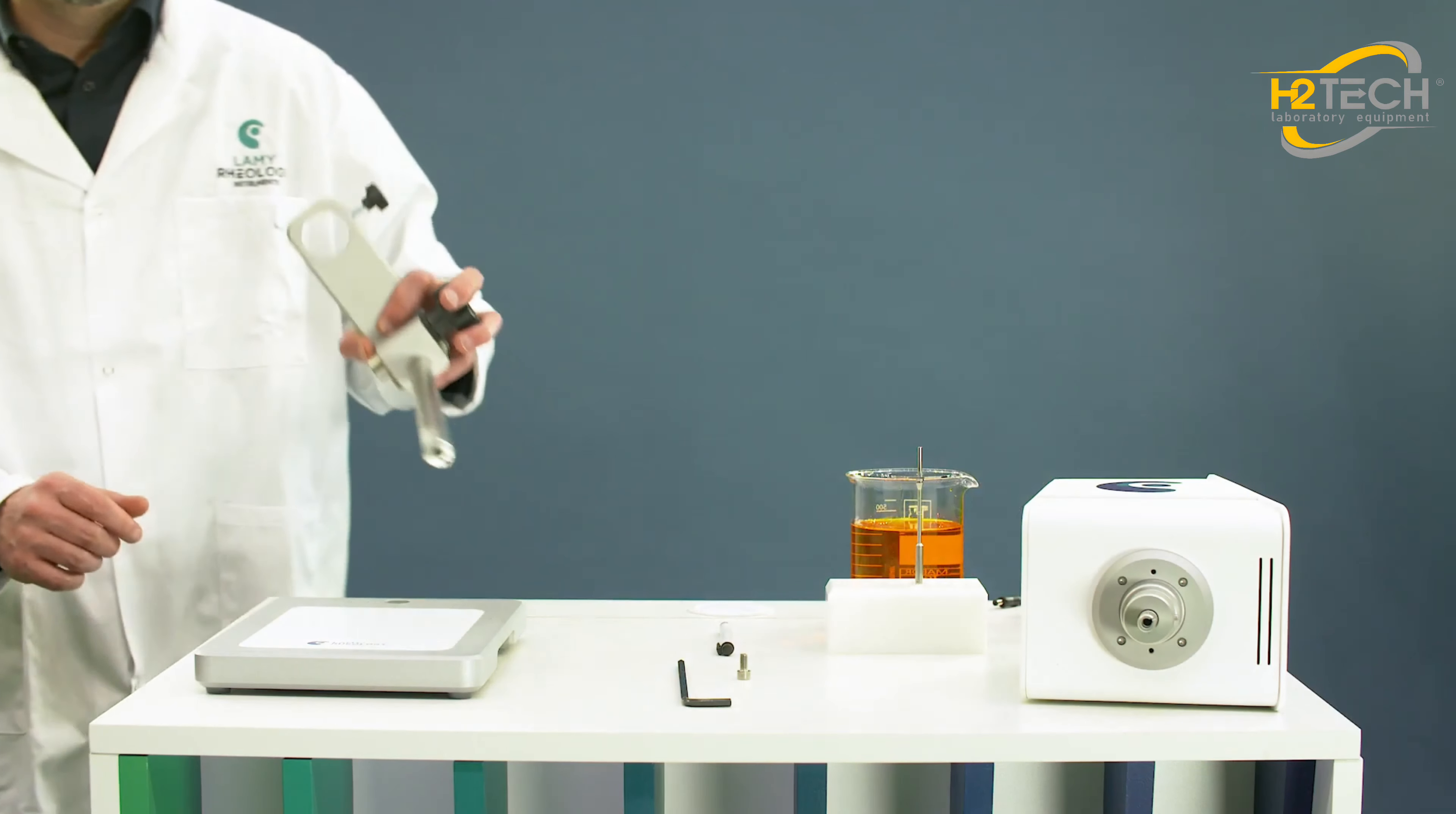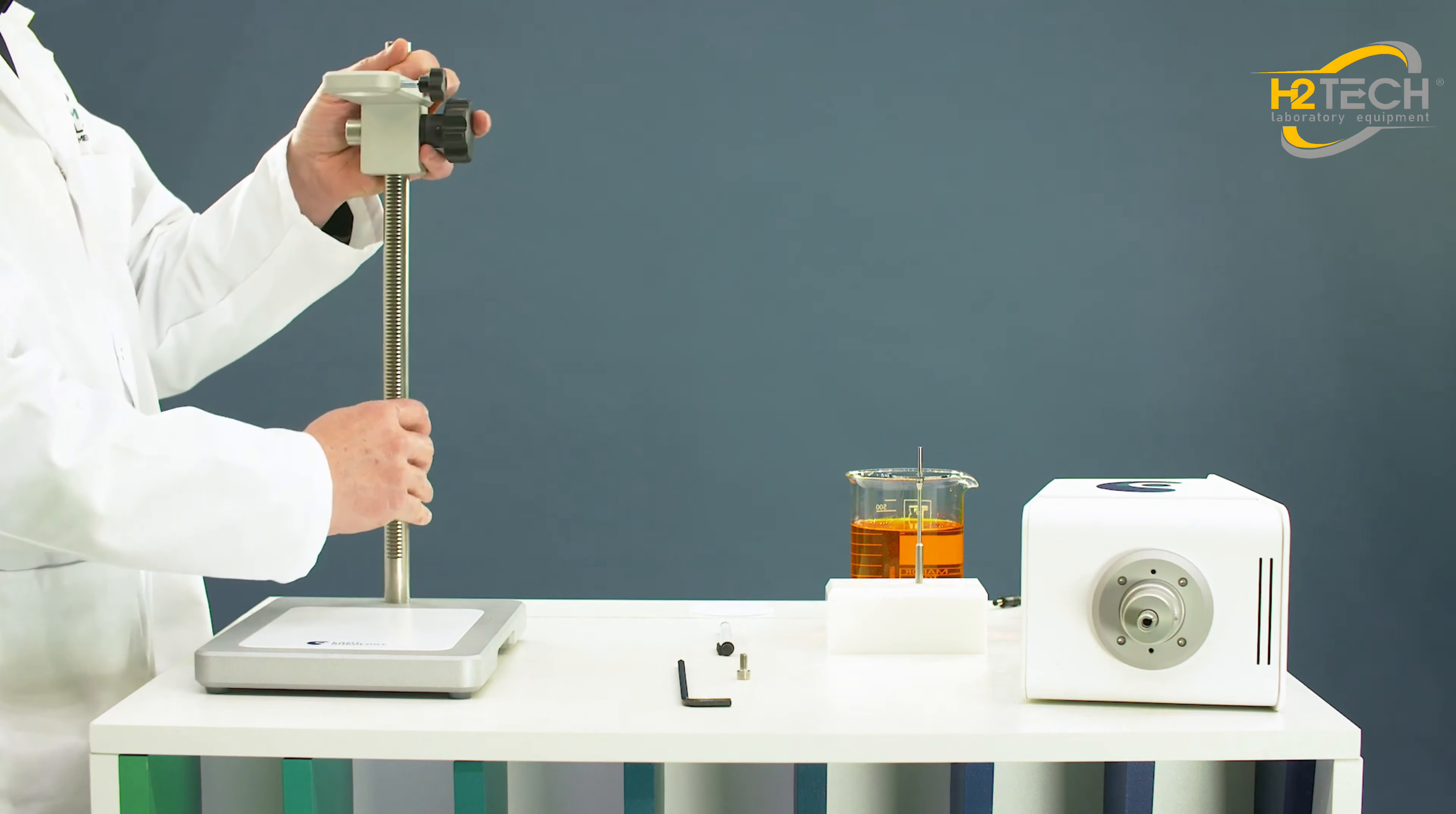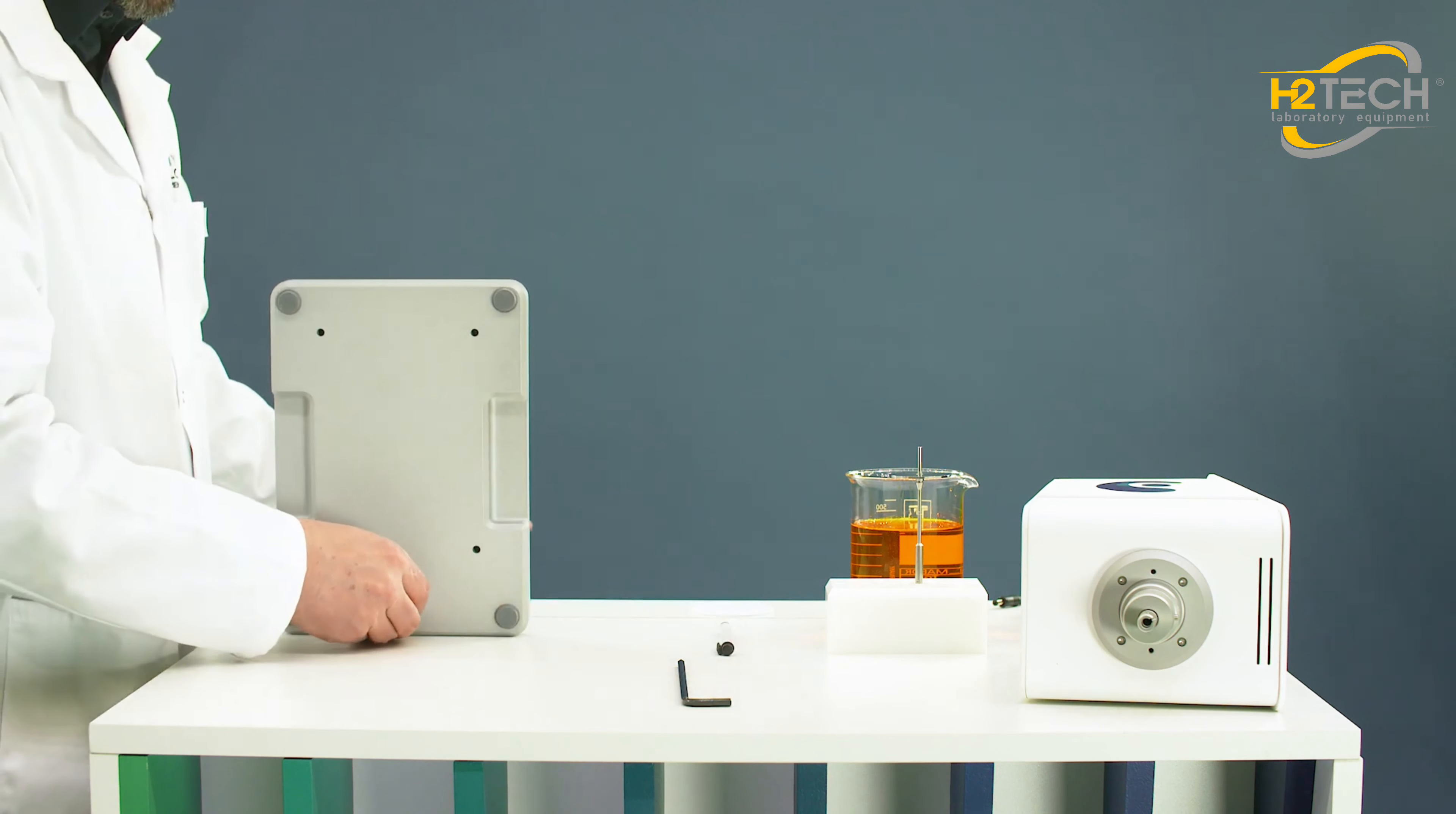Mount the stand to install the viscometer. Present the rod with the arm on the lower plate. Fix the rod with provided screw.